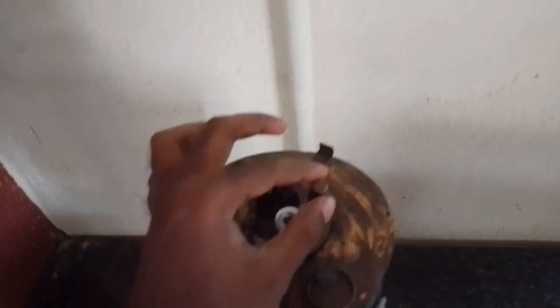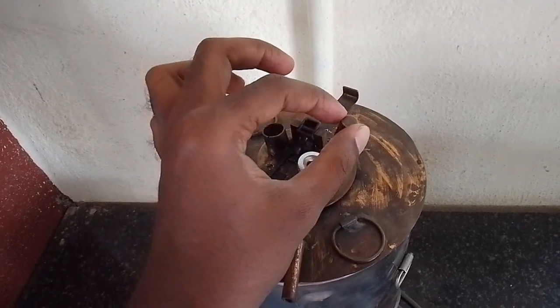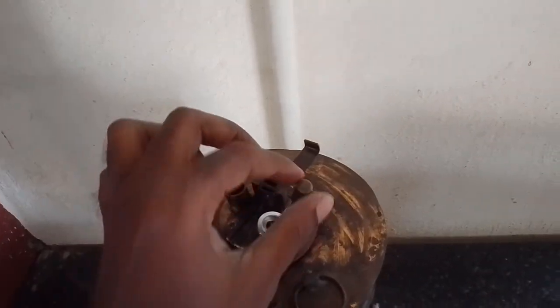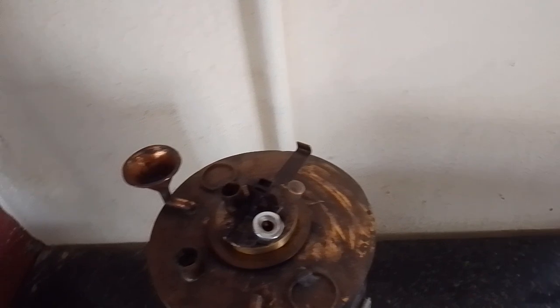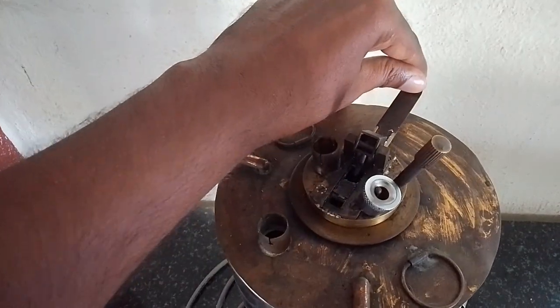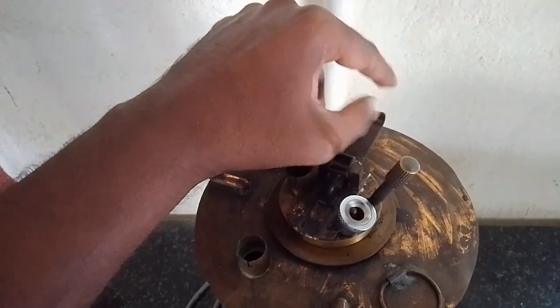You are going to have a stirrer here. You can see that you are going to rotate it. This stirrer is used for normalizing the temperature, or the distribution of temperature. And here you have an opening lid. You can see that when it is moved forward and backward, it is opened.